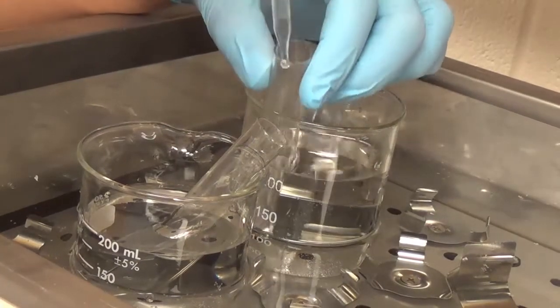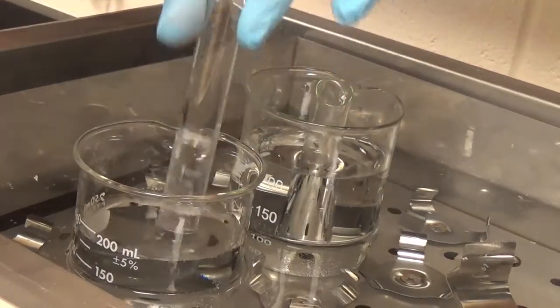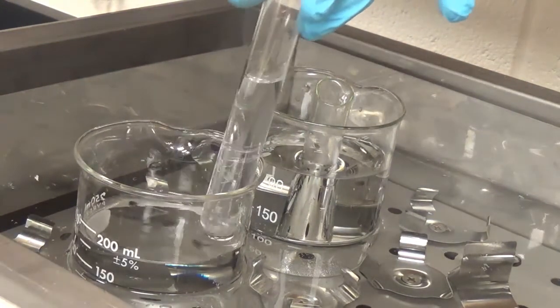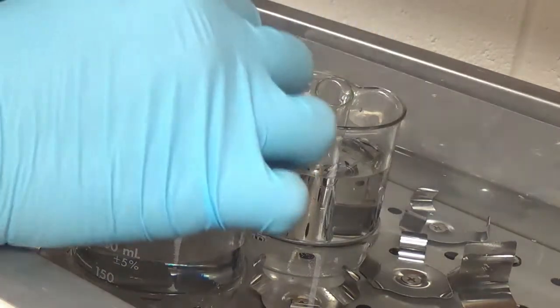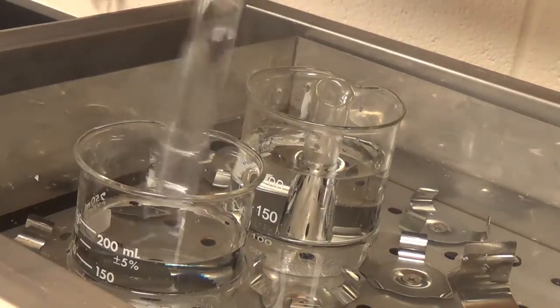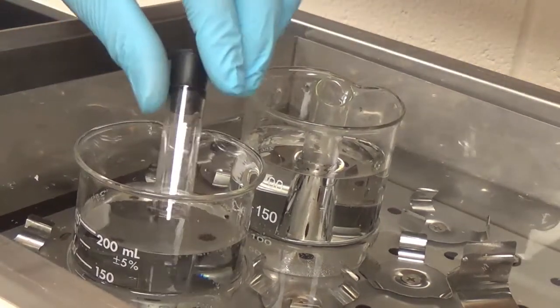All right, so here is our 2 mils. Remember, this is at 35 degrees C, higher temperature. That little cork in there. Give it a good shake. We already have the timer set up, and let's see what happens here.